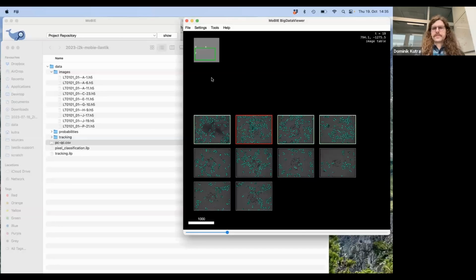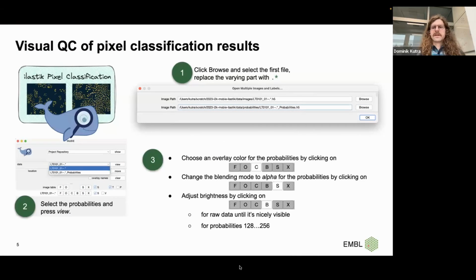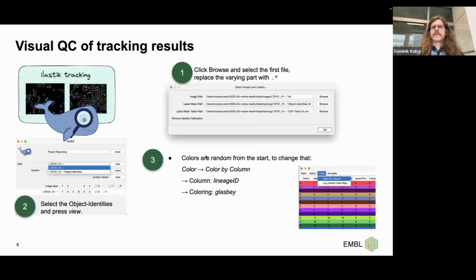Okay, so this is about it for pixel classification. I think I recorded everything I have done here in terms of interactions on the slide as well, so you should be able to follow. And then going on and doing this for tracking, you can also leverage what Tischer showed before a little bit, like that you can add a table and show different characteristics derived from the table for your different objects. And for tracking, this is super handy, because we then can assess how the tracking went.